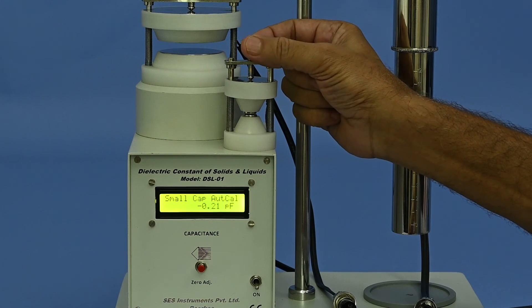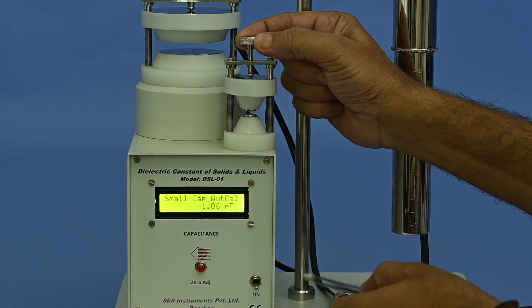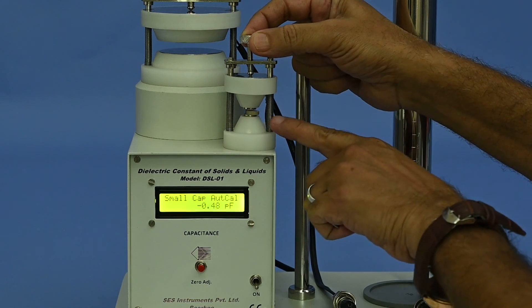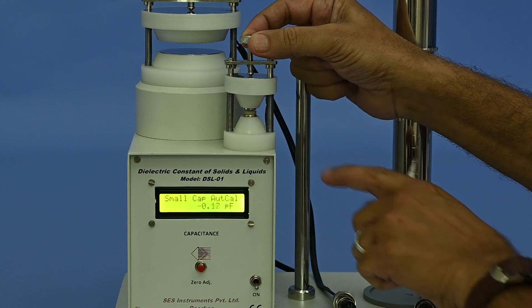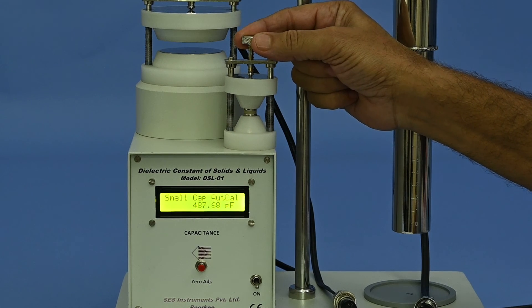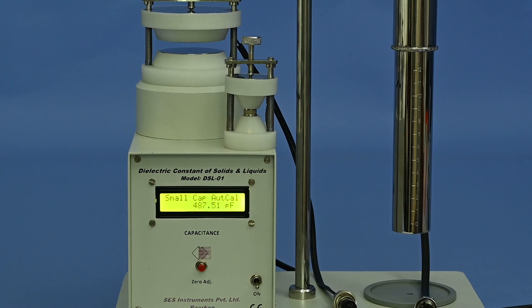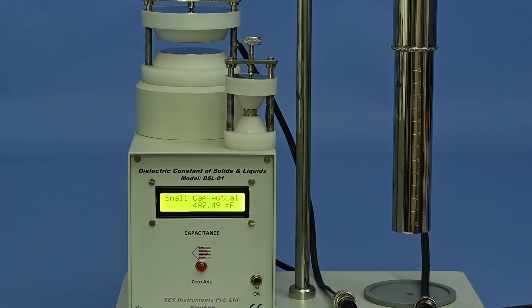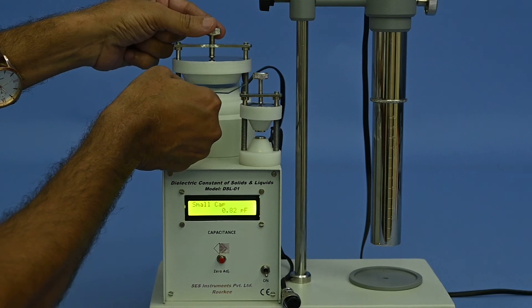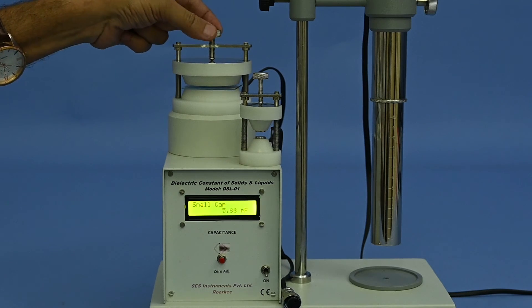Raise the upper plate of the selected arrangement by unscrewing it and place the sample. Then screw it clockwise until the plate firmly touches the sample surface. Now record the reading of the capacitance. The reading is 487.49 pF. Similarly, we use different samples — glass, Bakelite, and Teflon.